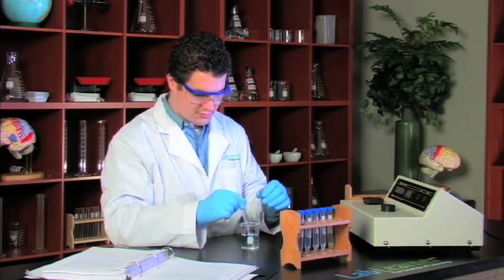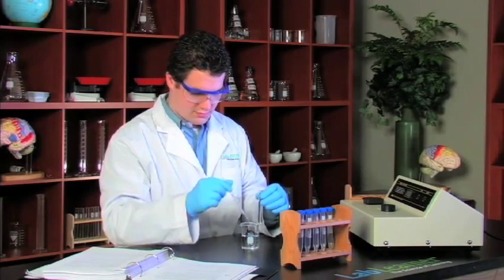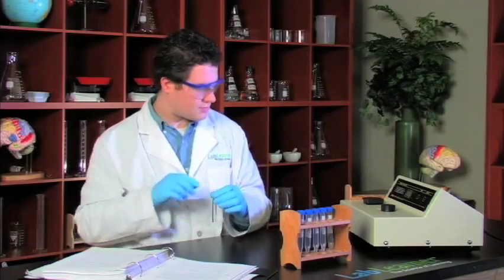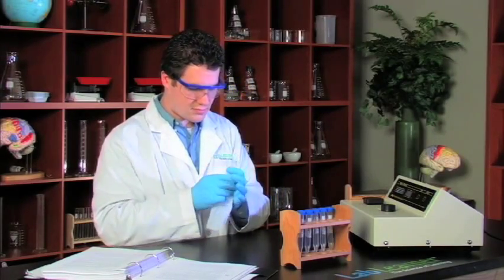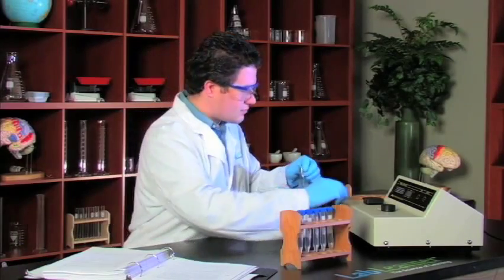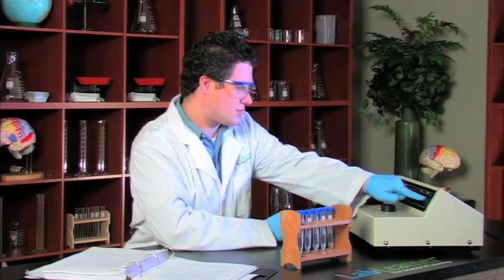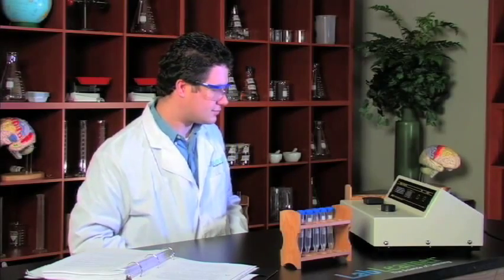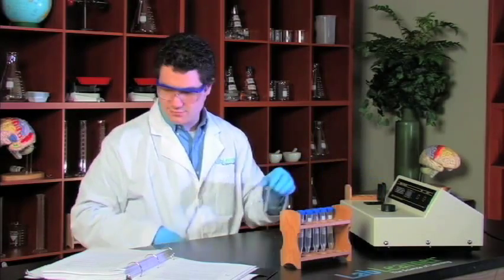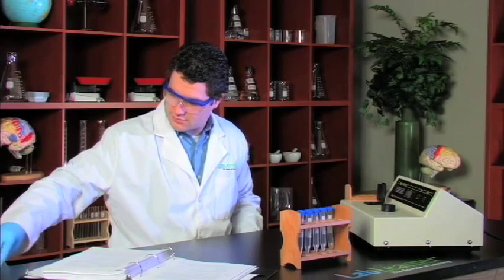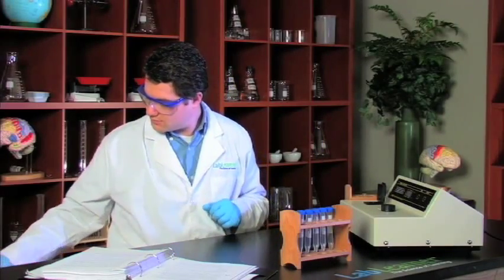First, to use the spectrophotometer Phil's got a blank. He's set the wavelength at 460 nanometers. He's made up a mixture of the acetone, water, and HCl just like all six of the reactions and he uses that to blank. So he pushes the blank button and waits until he gets an absorption of zero, so that would be the absorption of all of the reactants except for iodine which we'll be measuring in our readings.